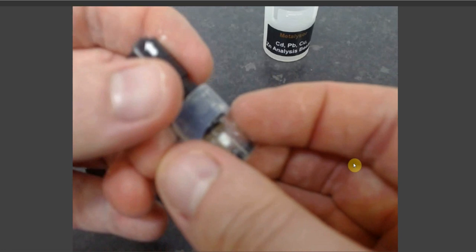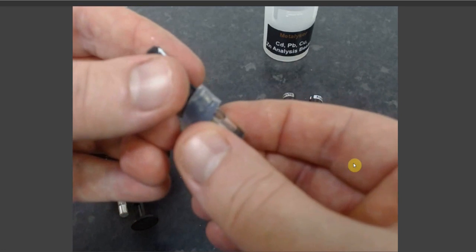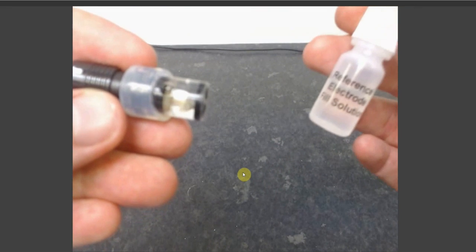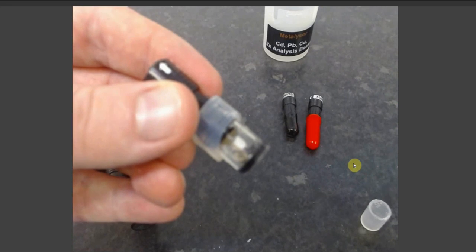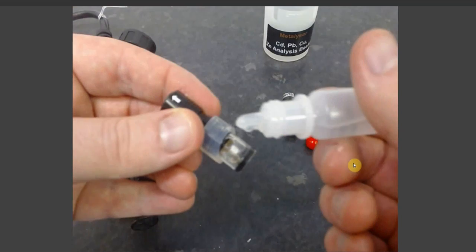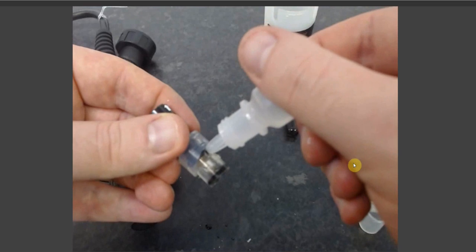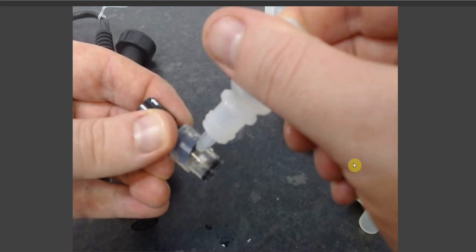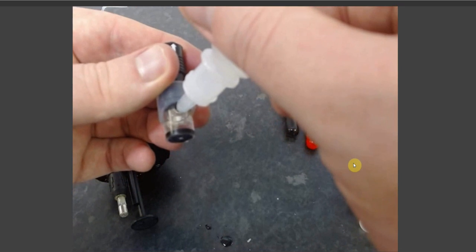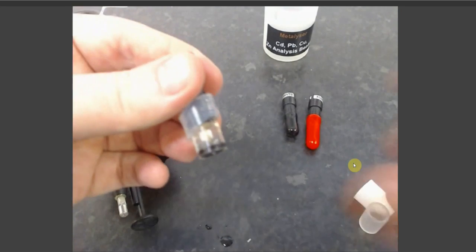To refill a reference electrode for a Metalyser unit, simply peel back the sheath from the central chamber, like so, which will expose a hole within the hard plastic outer casing. Take your reference electrode fill solution, unscrew the cap, and you'll find that you have a nozzle with which you can simply tilt up the reference electrode and gently squeeze until you have refilled the electrode entirely.